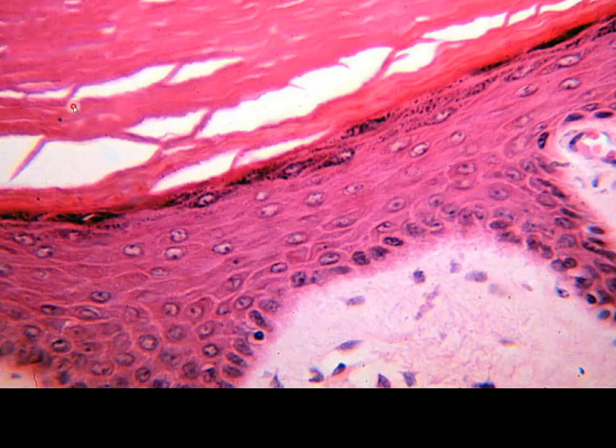See how that's red? That's more pink here. Again, this one is hard. It's not a very broad band. That's going to be lucidum right in there.